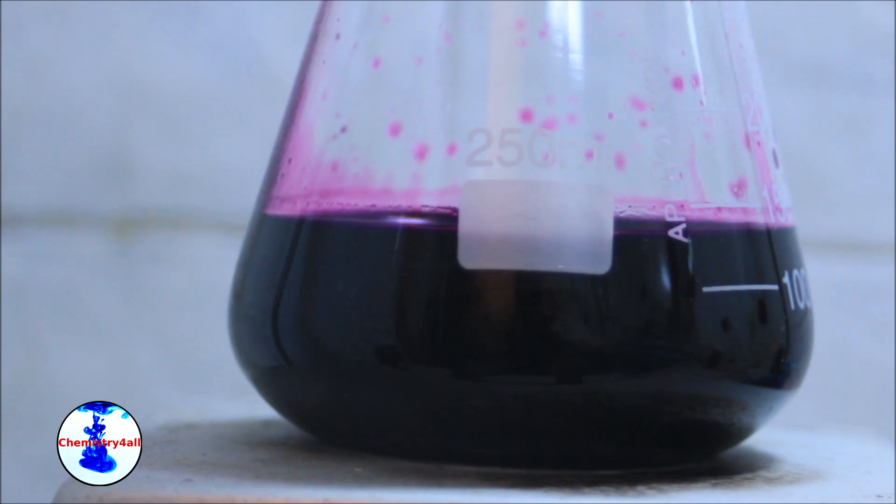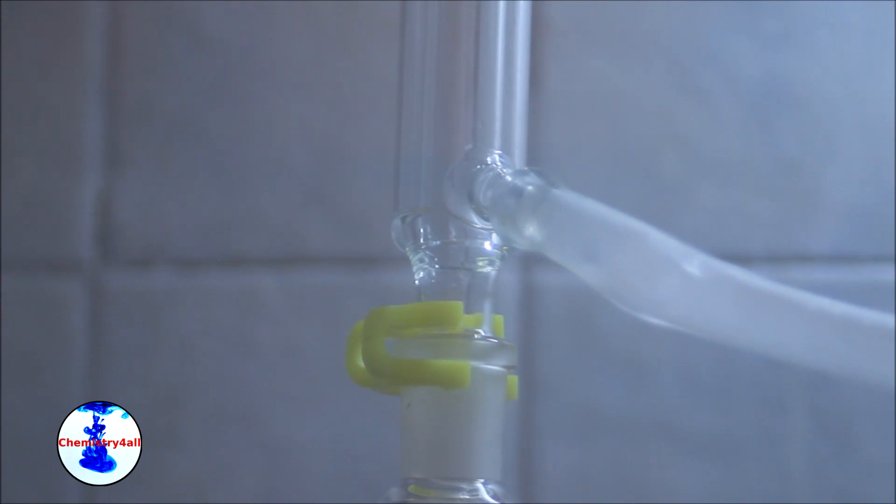Then the toluene is slowly added to the flask.